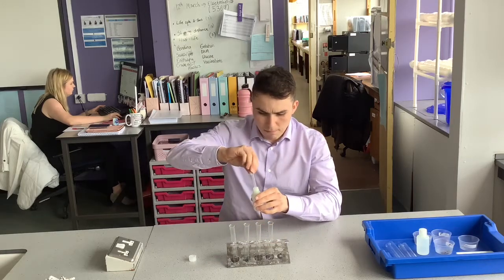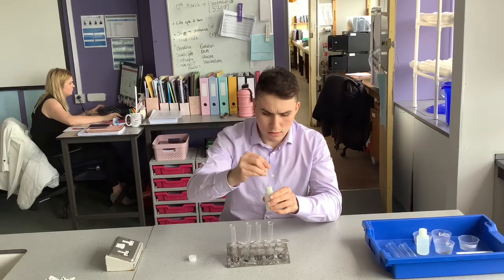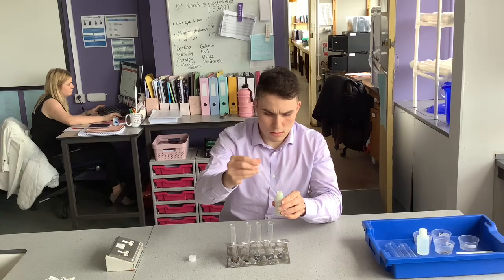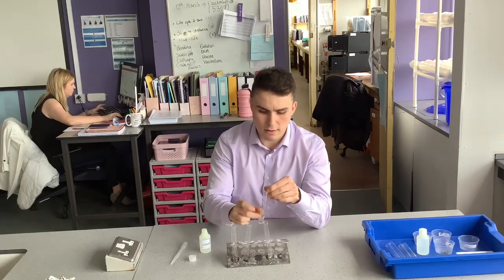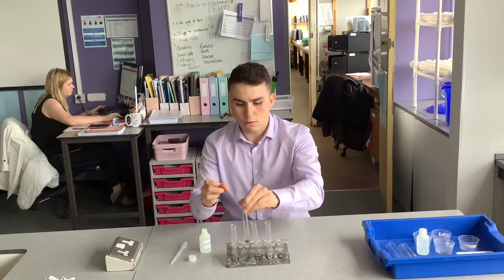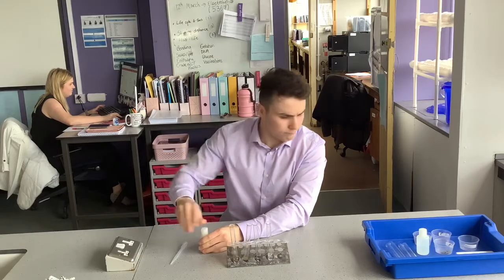So in each of these, acid in, and then each one a flick to get them started, and then we'll be able to look at some observations. Okay, I'm going to leave that while I tidy up. Reaction should be starting.